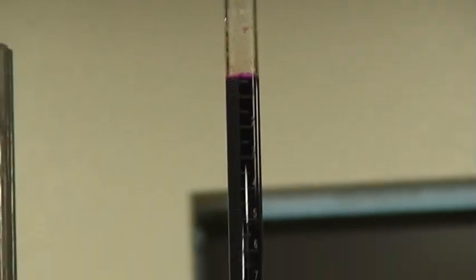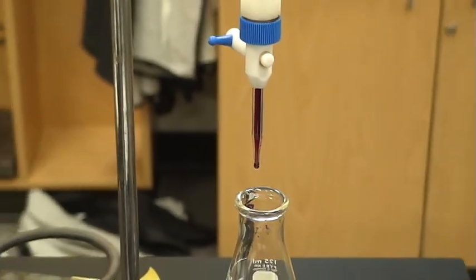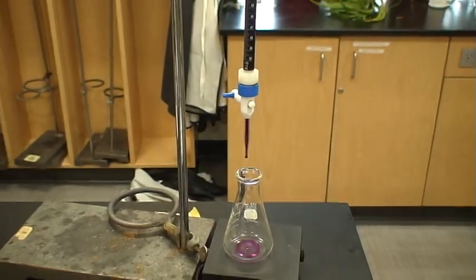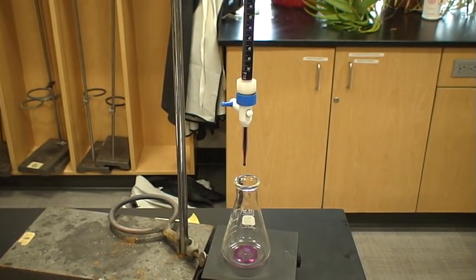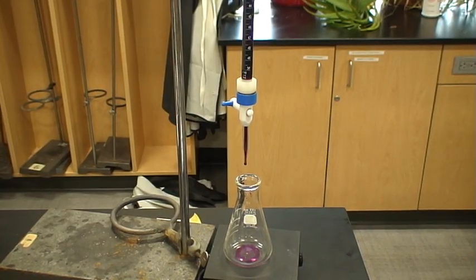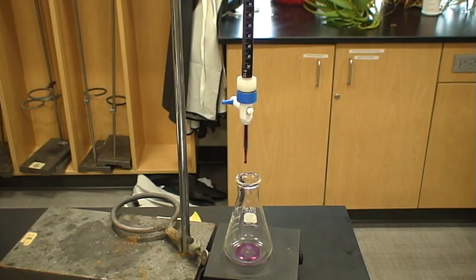Okay? I read that very carefully, and then I'll be depositing this permanganate down into my solution, and I just simply have to record the volume that I've dispensed. Okay? So that's the basic setup with it. And I'm going to zoom out just a little bit more. Okay, there we go. All right, so my solution is ready to go. It is at the temperature that I need, and I'm ready to go with this.